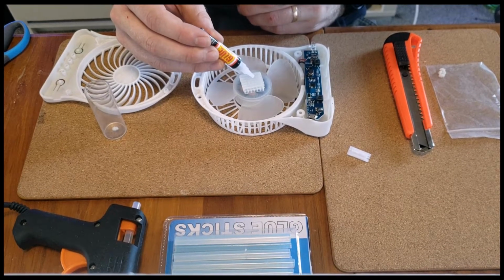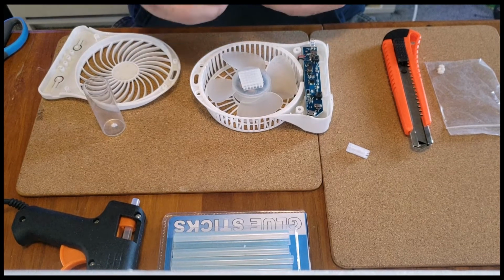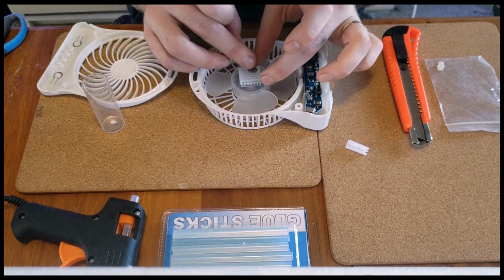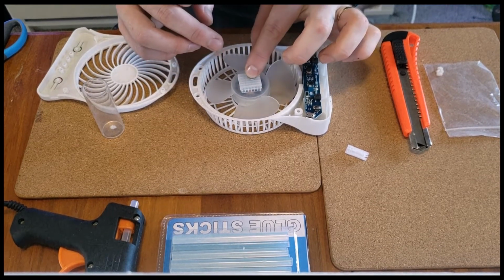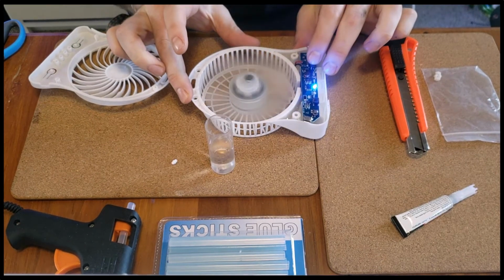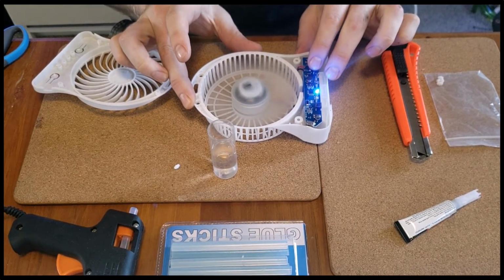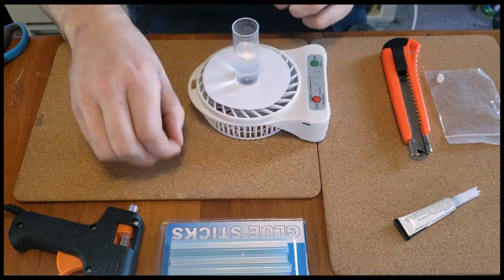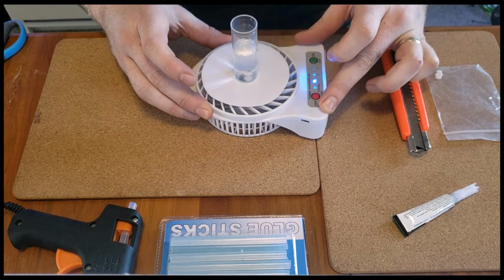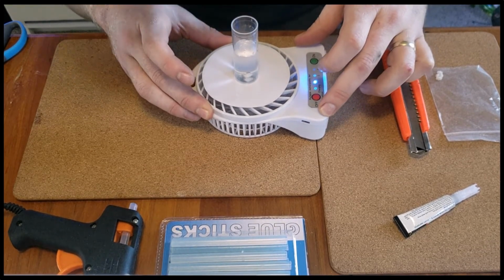Now that I'm happy, it's time to use a little bit of super glue and super glue my magnet on slightly off center. The reason we want it off center is so that when it spins in a circular motion it creates a vortex. Again, it's time to test it and you'll see what I mean here. Time to pop the bead inside the vial and create that vortex which you can see right now.